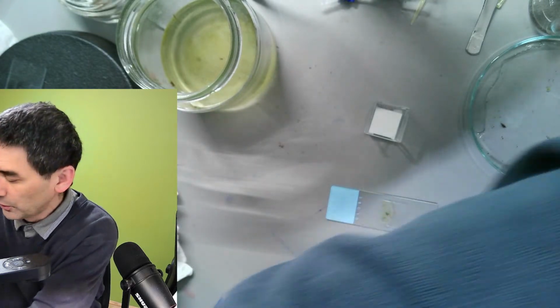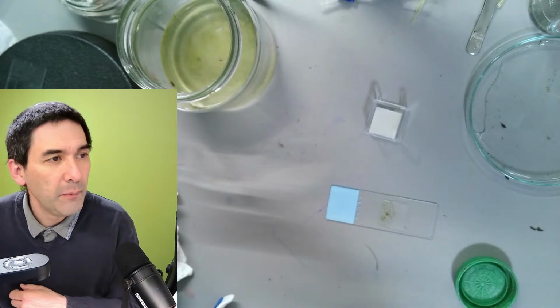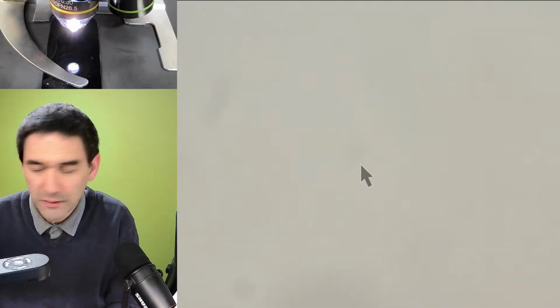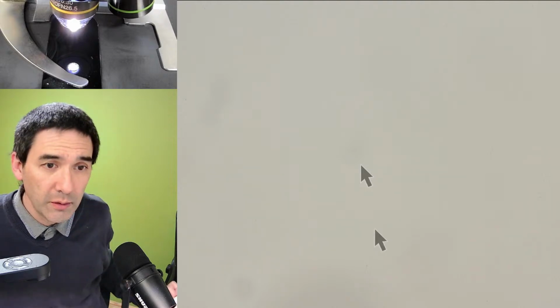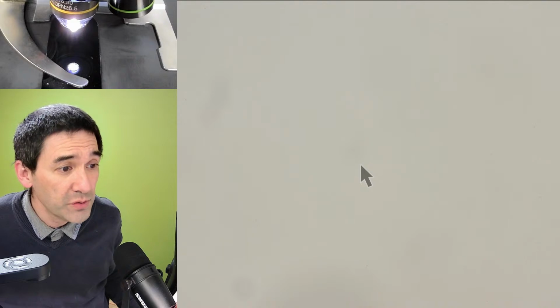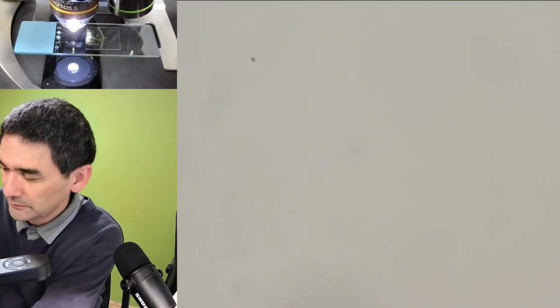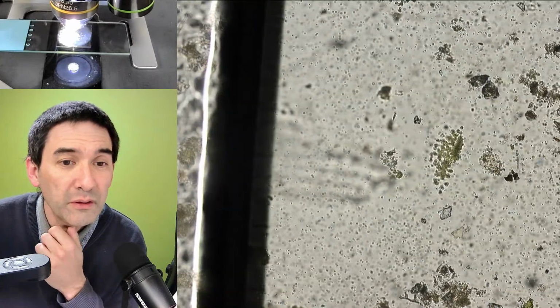So let's remove the other slide here. And where is the scope view again? Here we go. I don't like the arrow. I've got too many arrows now. Let's move it away. Here we go. And let's give it a try. No movement.